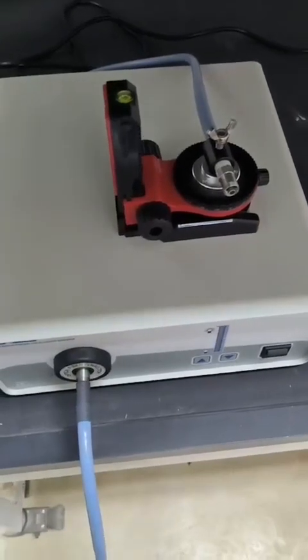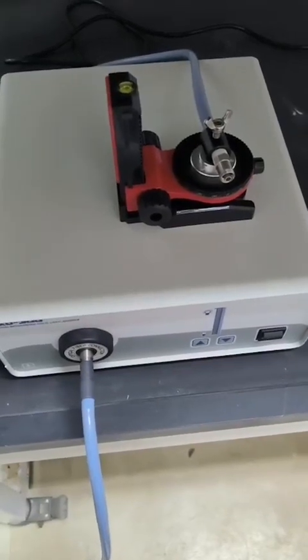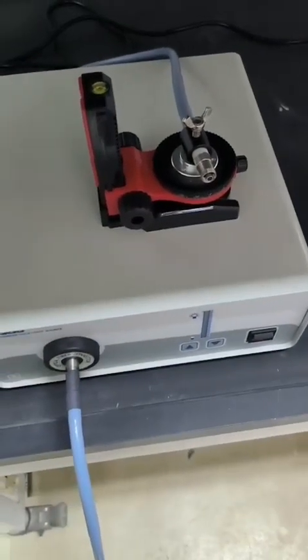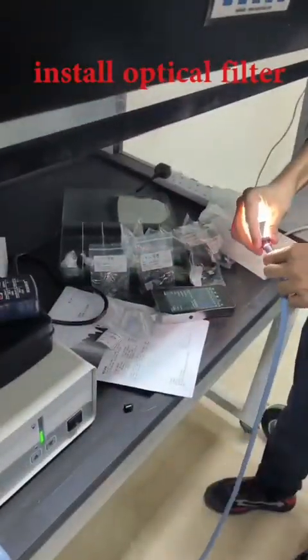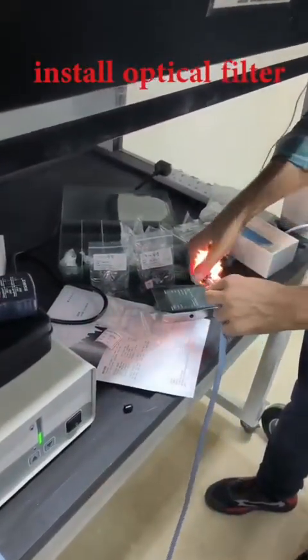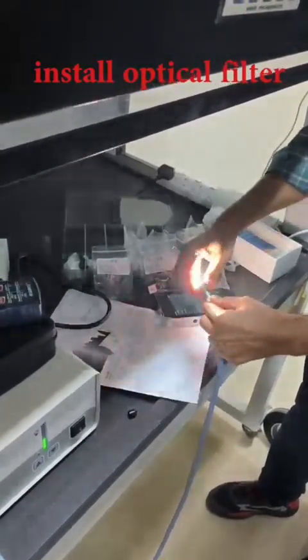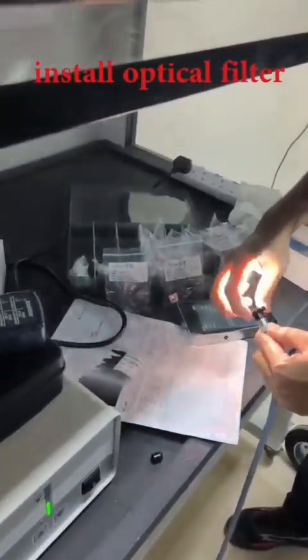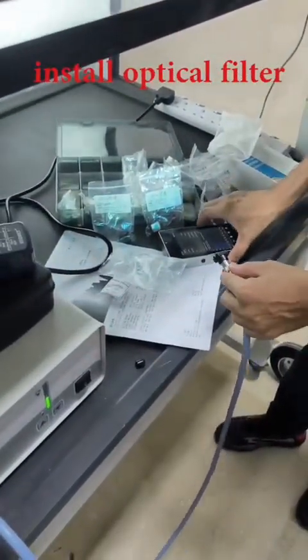If you want to use a filter, you can refer to our training for how to install a filter here to get a single wavelength optical resource. Install the optical filter by screwing it in. The one recently installed is for wavelength 420. Then you can test the distribution.